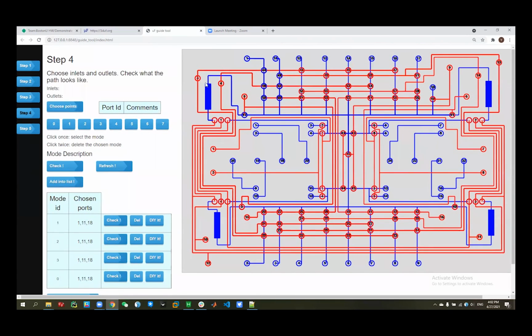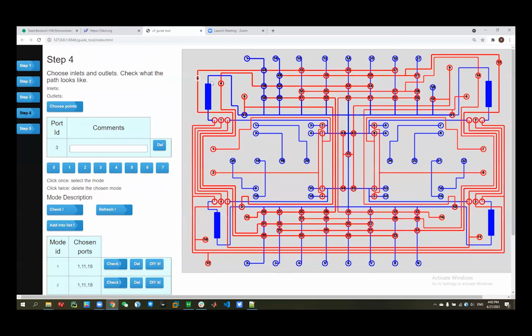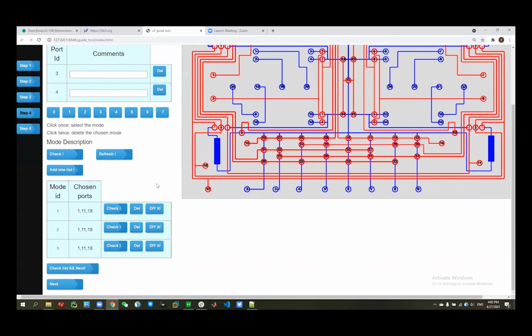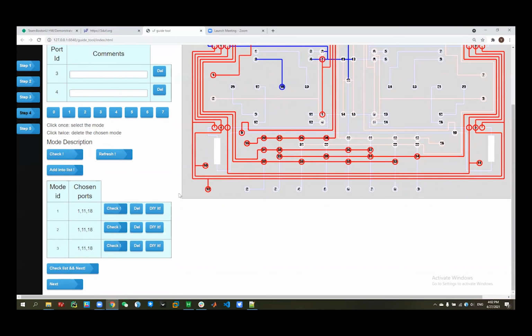So here you can choose if you don't think 3 should be opened, then you can click it and switch it off, just like this. And also you can delete it after you think maybe I don't need this now. Okay, so then we have these 3 modes, and we want to operate. What can this guide tool help you?